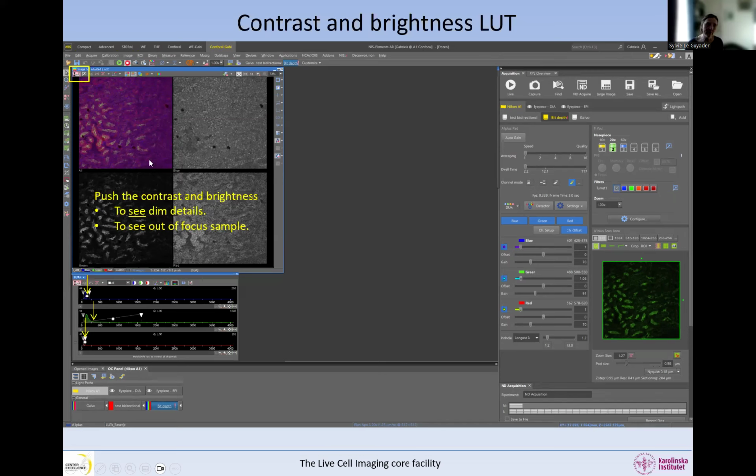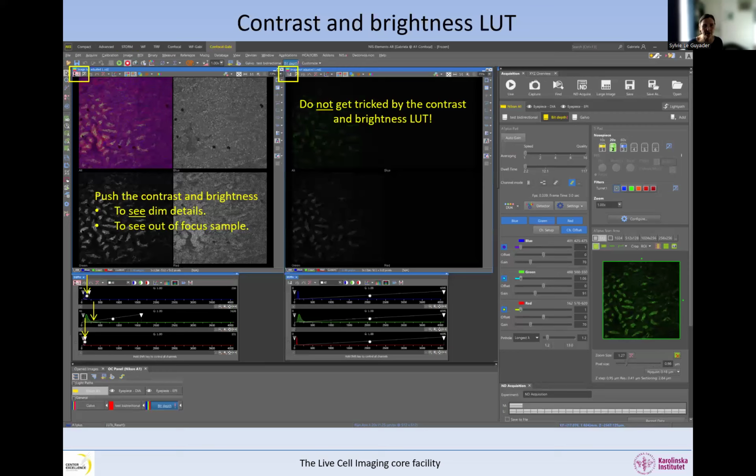So try to push the contrast and brightness to see the dimmest detail in the image. For example, when the image is out of focus, this is very useful. If you find the sample in the eyepiece and then go back to imaging, very often there is a difference in focus between your eyes and the detector or the sensor. Then when you grab an image of fluorescence, it's completely black. Do not start changing the focus randomly without seeing anything. What you want to do is first push the brightness and contrast, and you will see the sample slightly out of focus. Then that allows you to refocus safely. This is one of the numerous applications of pushing the brightness and contrast.